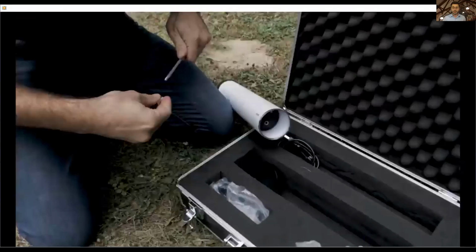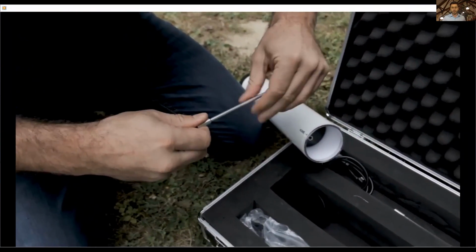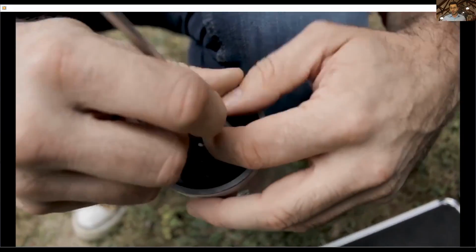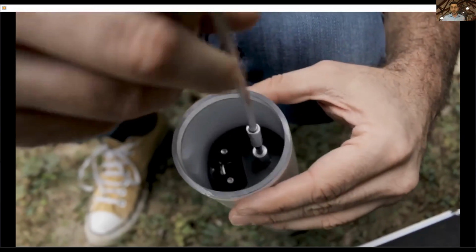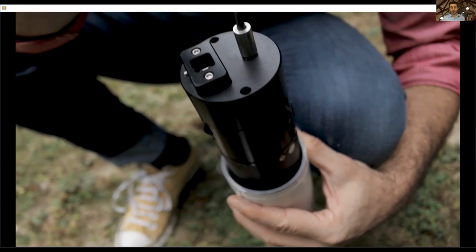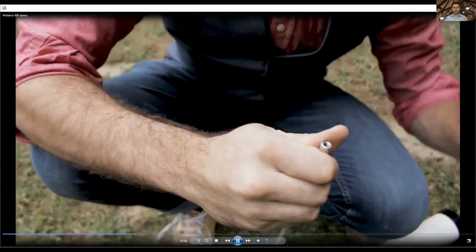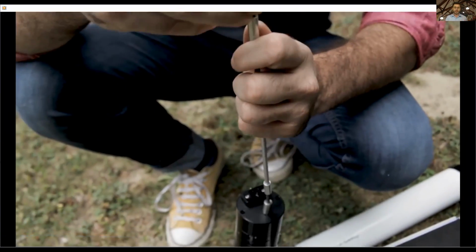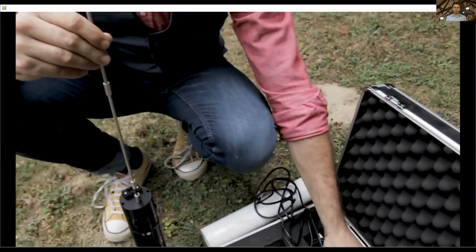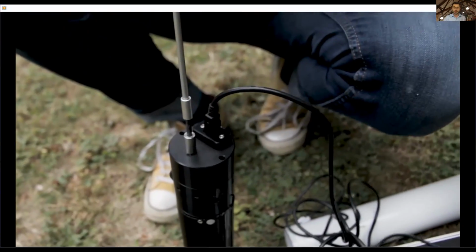You have the scanner itself, as well as a slider rod. Actually, there's a dozen names for this thing, but what it does is you can just attach it to the scanner like so, slide it in, slide it out using the wheels attached to the scanner. And those rods actually have different lengths. So you can use these lengths with the cap that we also provide to measure out as you're placing the scanner into the tube and then using it at different depths.